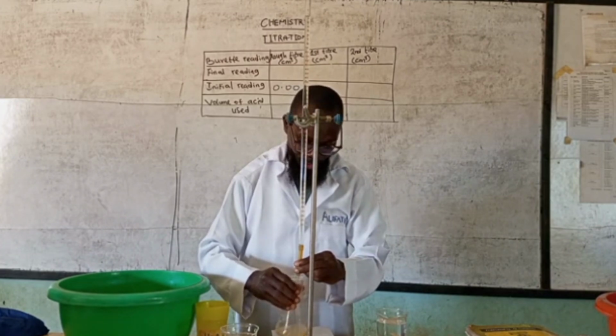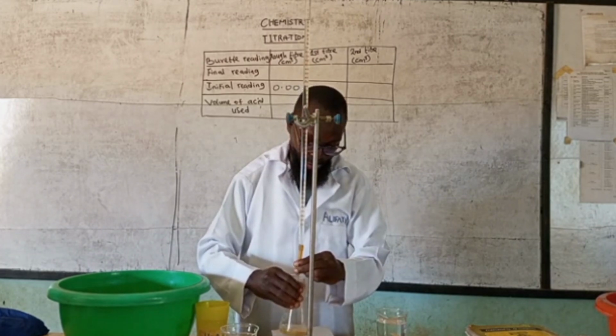When you are titrating, you don't rush it. You do it gradually.